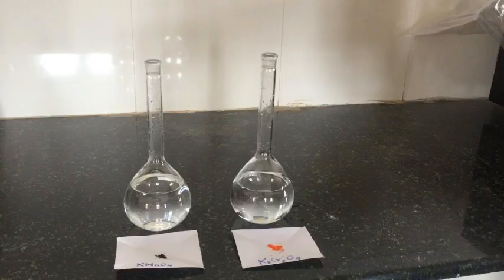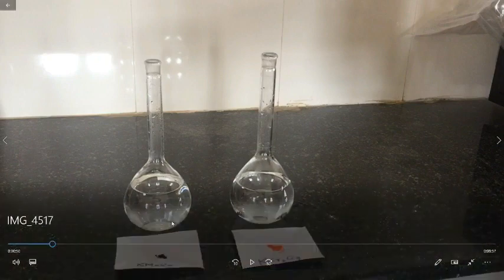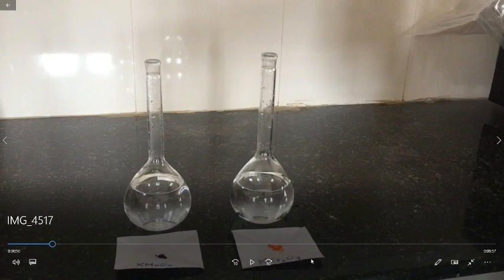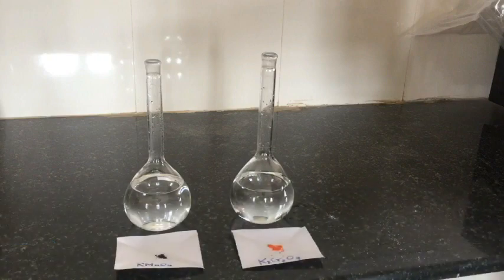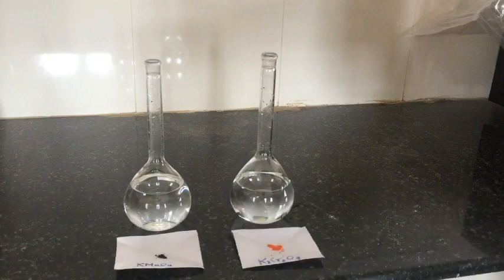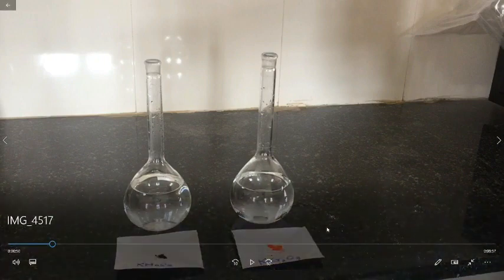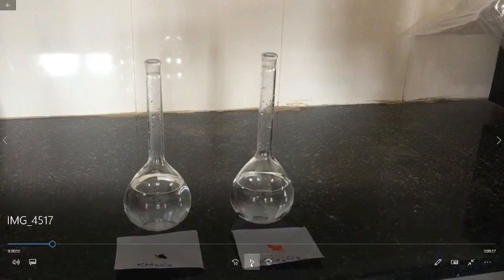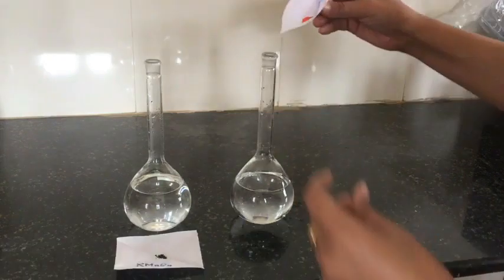Here I will show you that different types of solute particles have different movement. Here is my KMnO4 and here is K2Cr2O7 — I have taken these as solute molecules — and they will start diffusing at different rates.